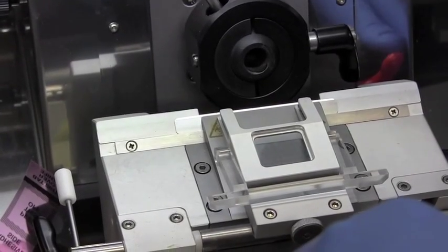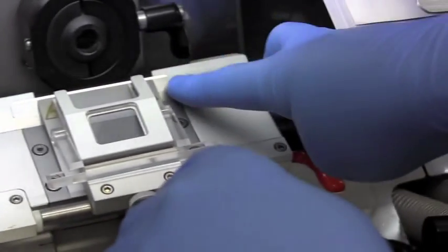The blade mounting goes in this way so that the sharp point is that direction, and then it is tightened down with the orange bar, and then it can't move.